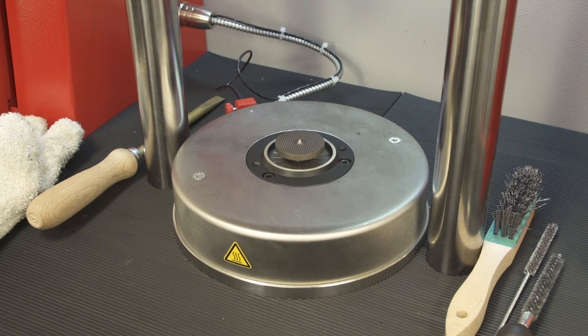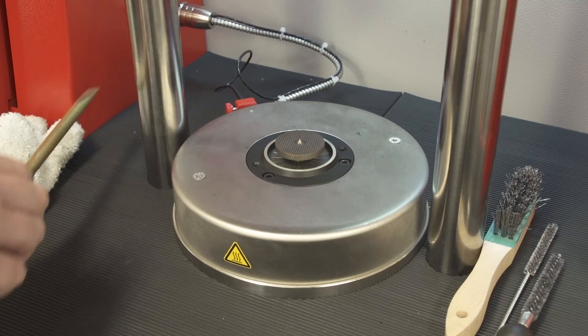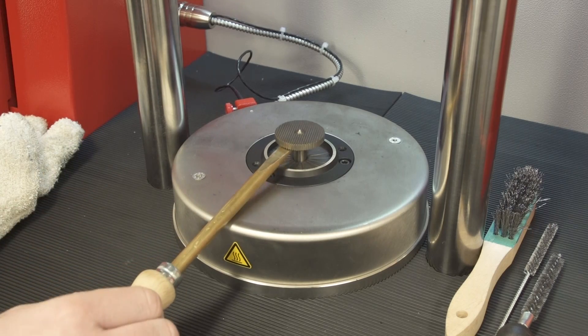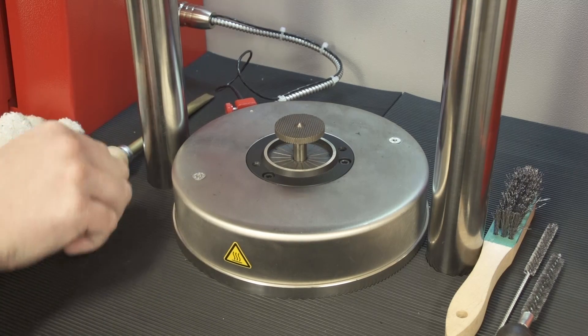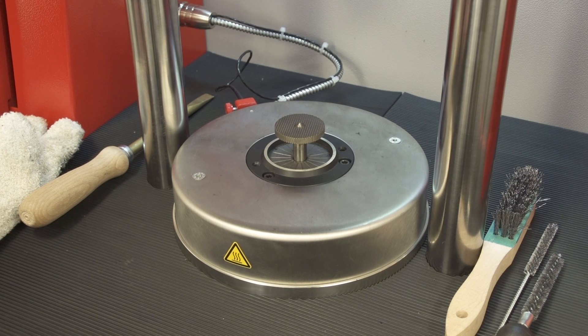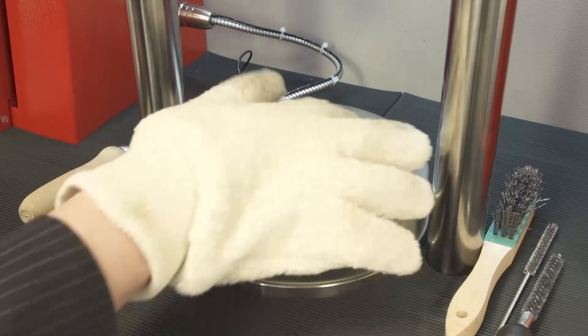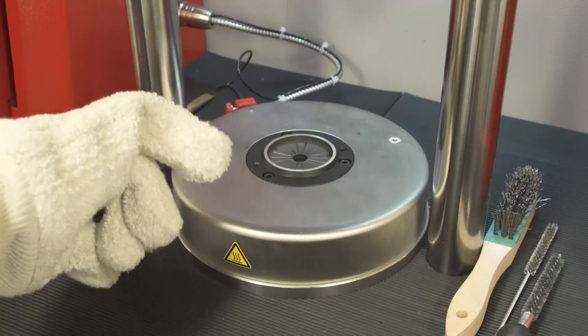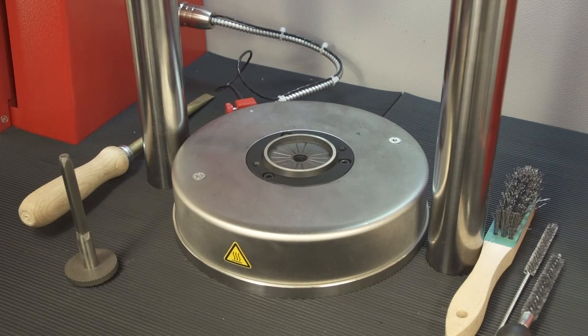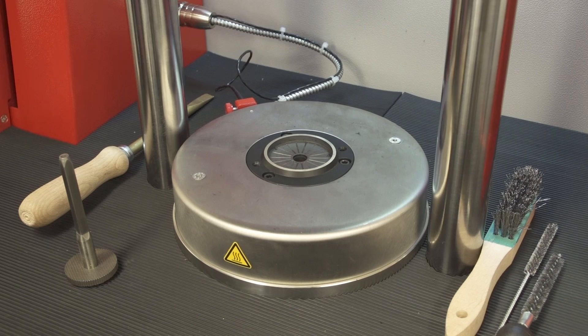To actually start a test and insert the sample, the rotor needs to be removed from the die area. As the die as well as the rotor are heated, always wear heat protection gloves before working with the rotor.